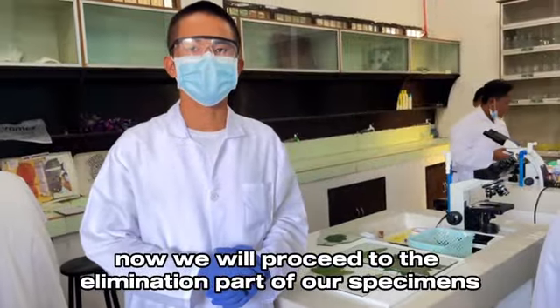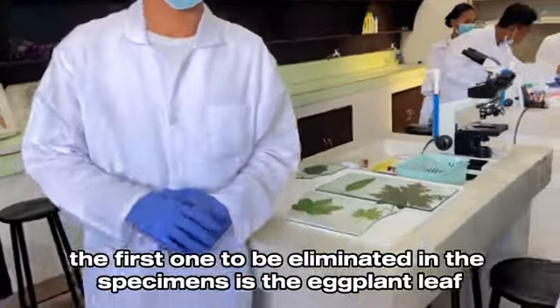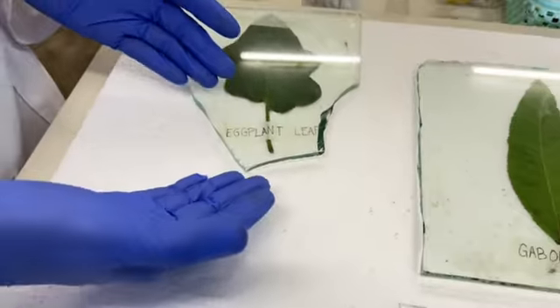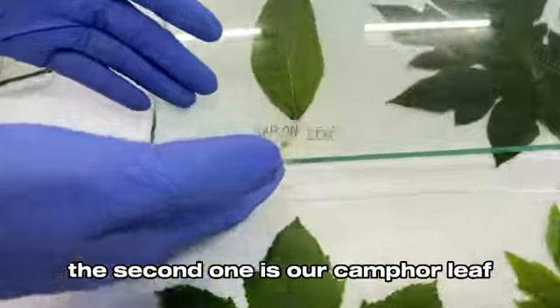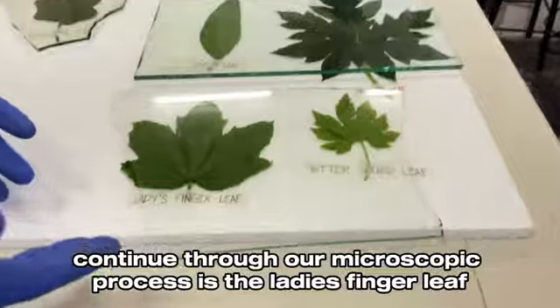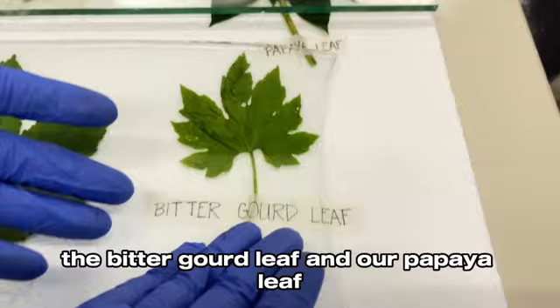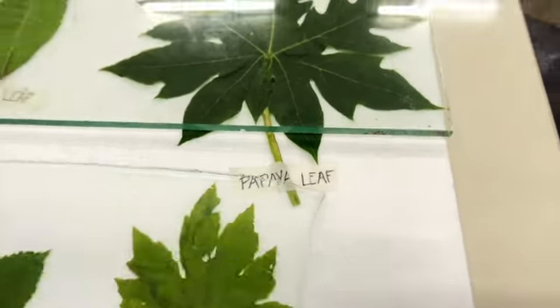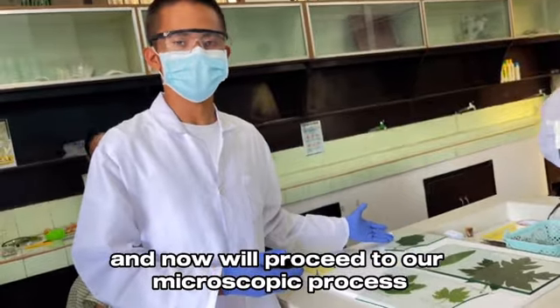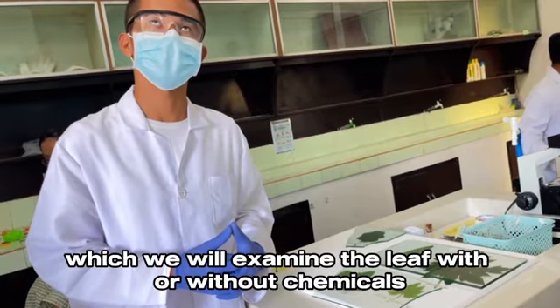Now we will proceed to the elimination part of our specimens. The first one to be eliminated is the eggplant leaf. The second one is our camphor leaf. And the specimens that will continue through our microscopic process are the lady's finger leaf, the bitter gourd leaf, and our papaya leaf. And now we'll proceed to our microscopic process, in which we will examine the leaf with or without chemicals.